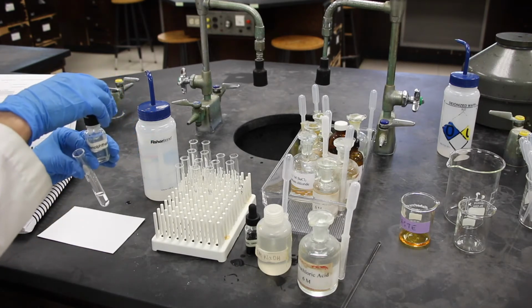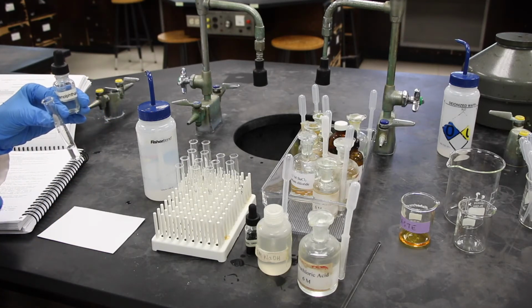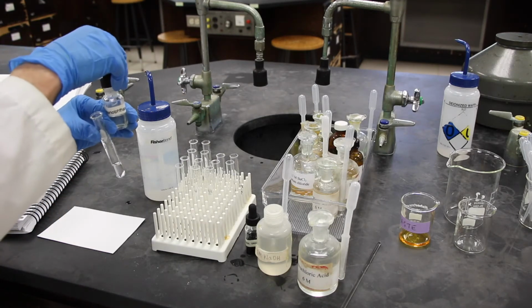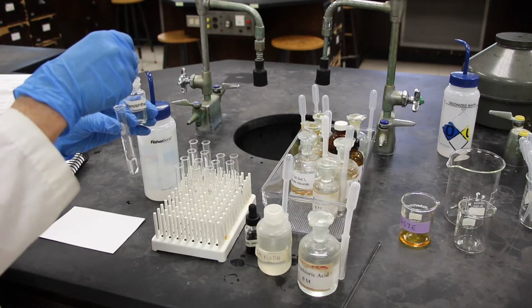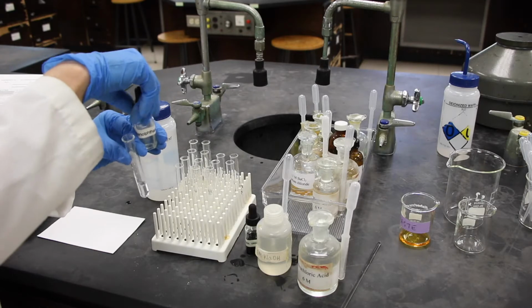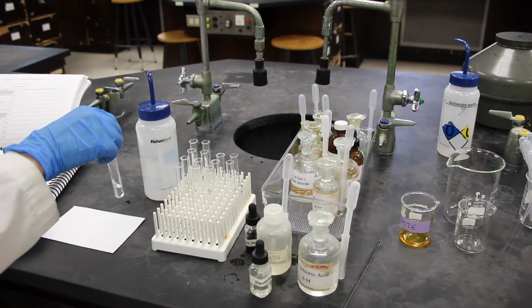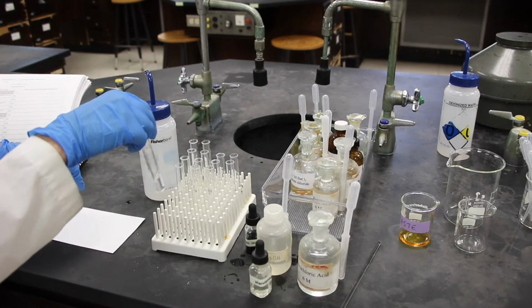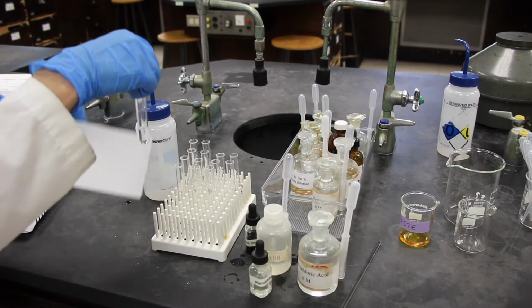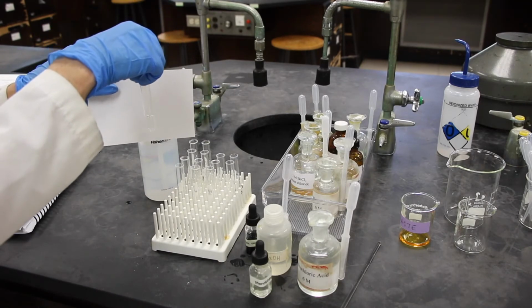And we know that phenolphthalein in its acid form is colorless, and its basic form is a bright pink. Okay, you can answer B11 here, the observation. You can tell whether it's in its acid or base form.